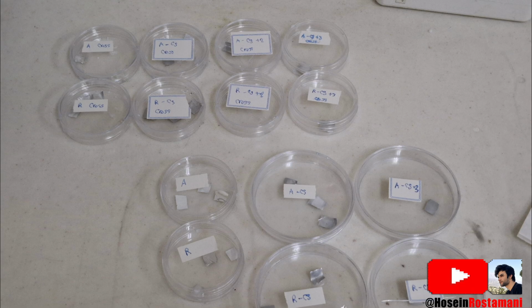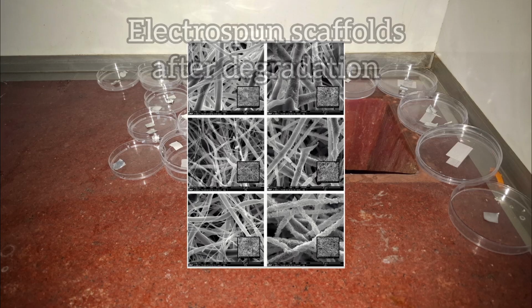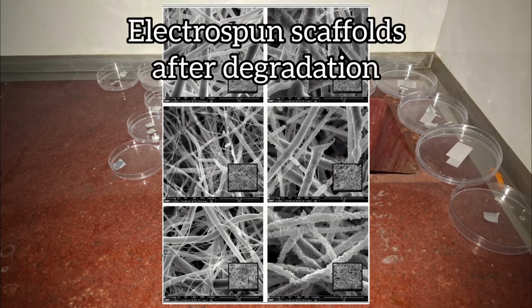Or in my case, if your scaffolds are electrospun, they may have been produced in two different forms, random and aligned, and each of these may have been fabricated with different material percentages, and each percentage again in both cross-linked and non-cross-linked forms. Make sure that for each specific sample defined by a unique set of variables, you have 3 replicates. Having 3 specimens for each sample helps you account for possible errors during the process.